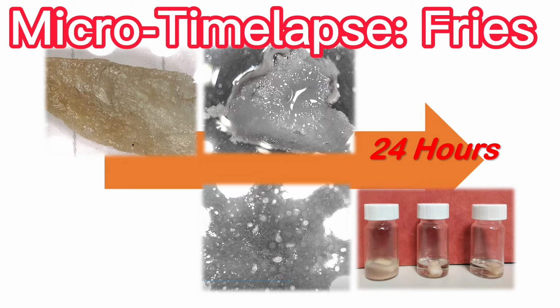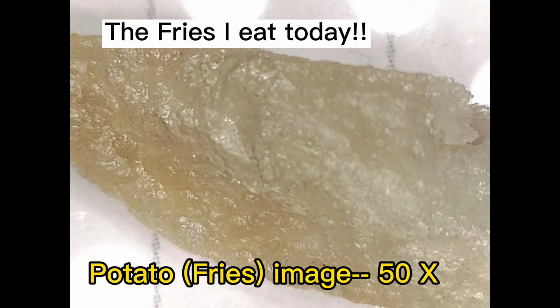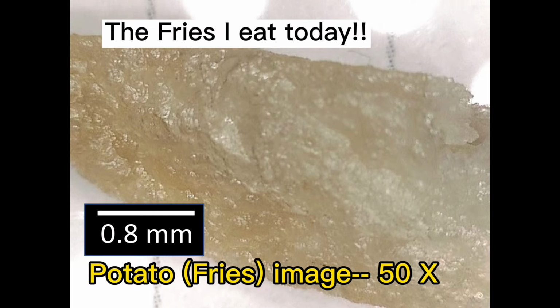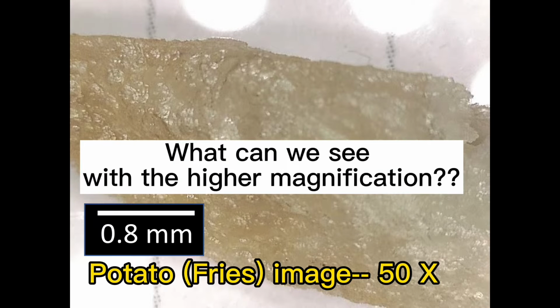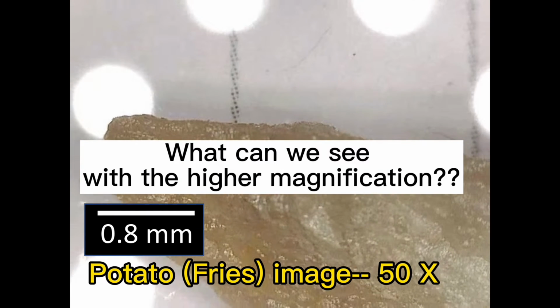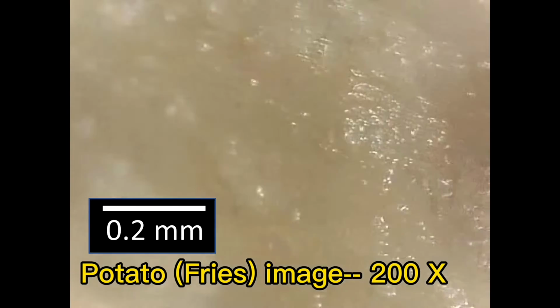Potato is a good carbohydrate food and is quite delicious when made into fries, which are one of the most common staples. However, during the frying process, how much oil remains in the fries? Let's use a microscope to see.